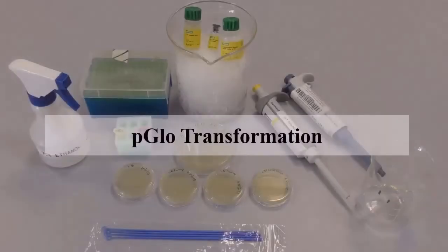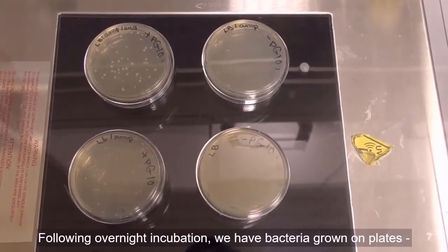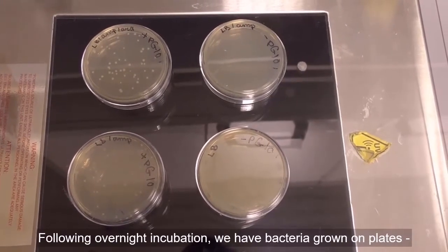Hello everyone, today we have the second lab in the series of pGLO transformation and GFP expression. And today we're going to talk about the results of previous seeding and also proceed with the GFP expression. Following overnight incubation, we have bacteria grown on plates.